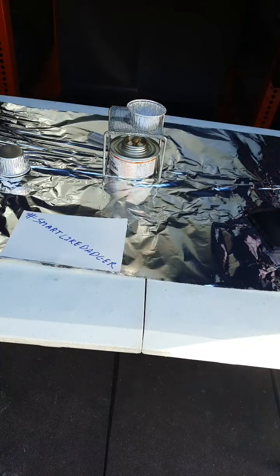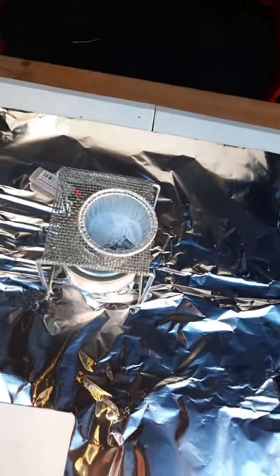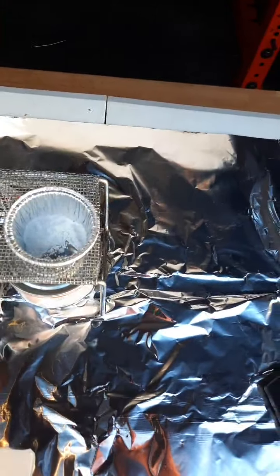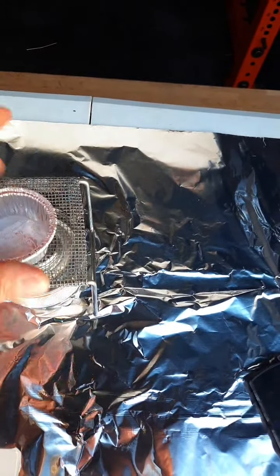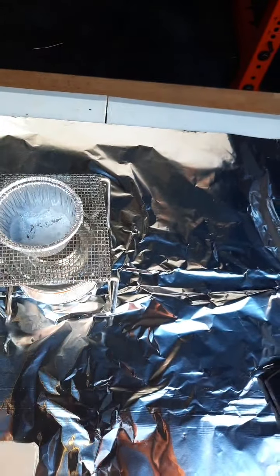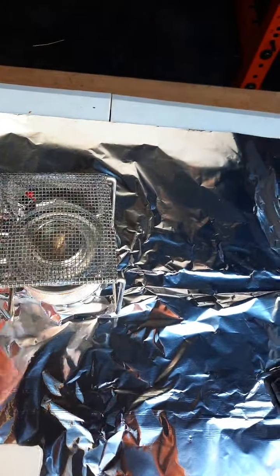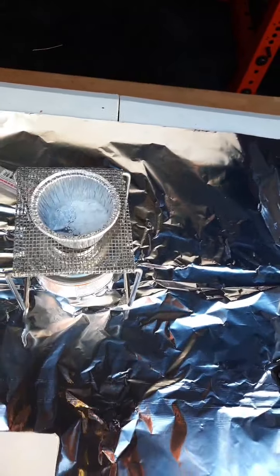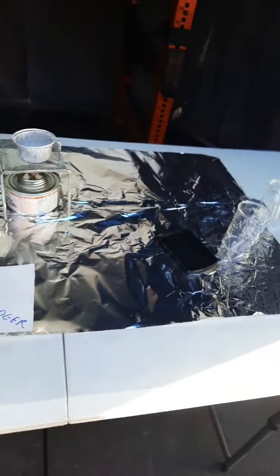Let me check the camera. Oh, yes. This is what it looks like very quickly. And what Boris is trying to do is just help it heat evenly. And Boris is very silly with bare hand. We'll come back with the clamp that you have in the lab kit.